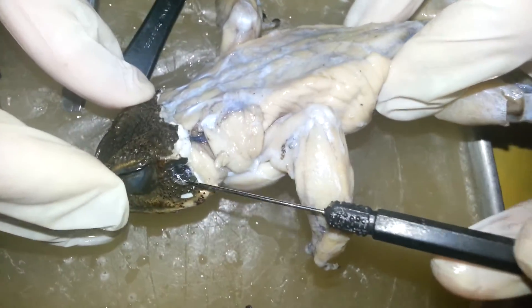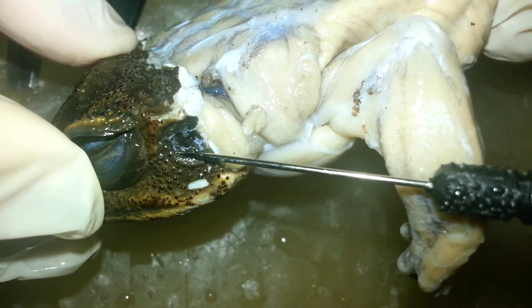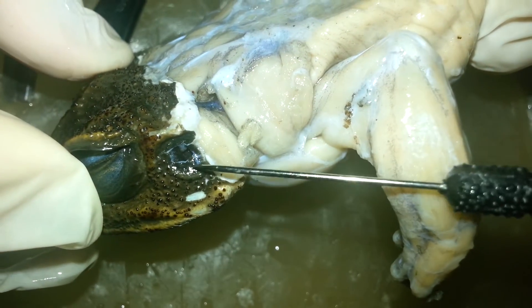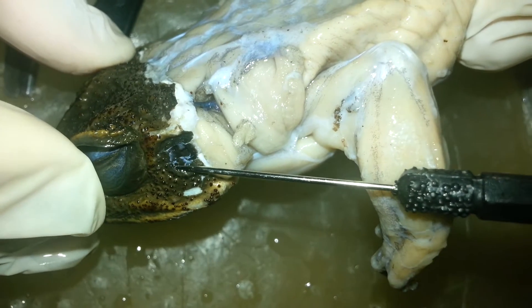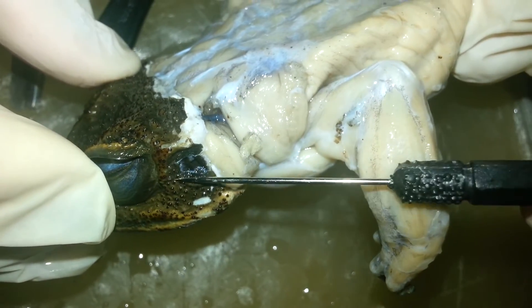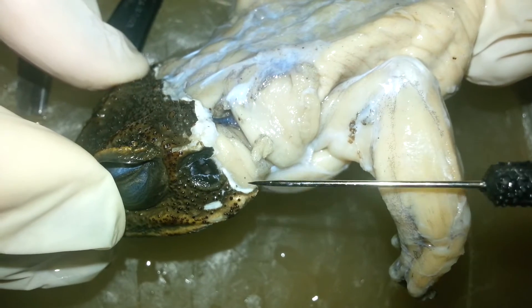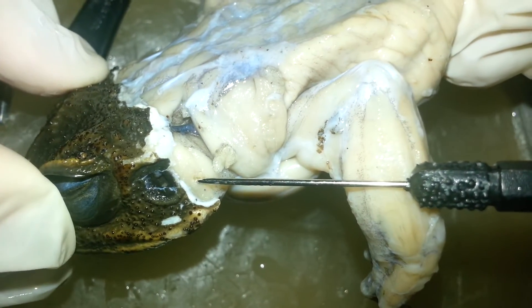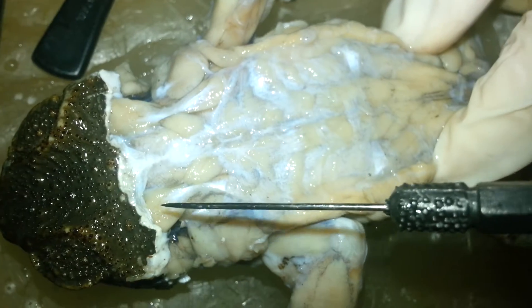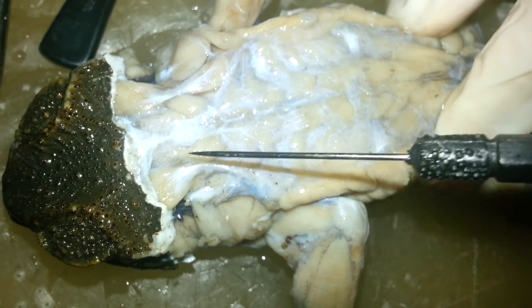Can I show you the temporal? Temporal — somewhere there, beneath the temporal. Masseters. Depressor mandibuli.